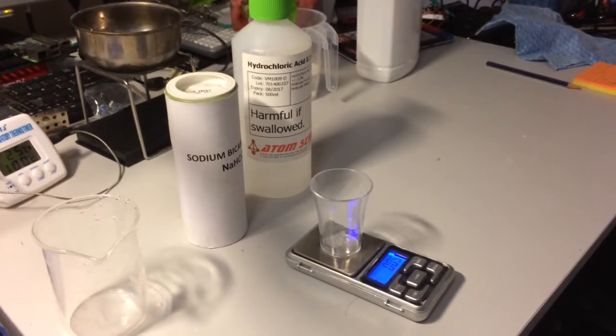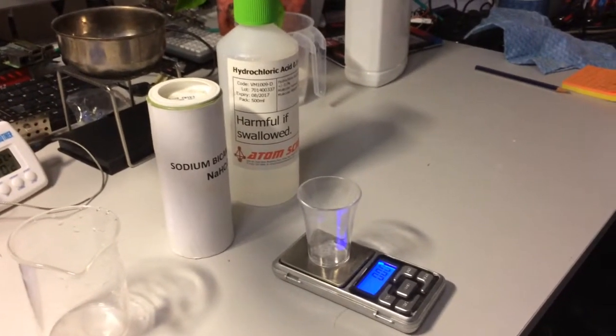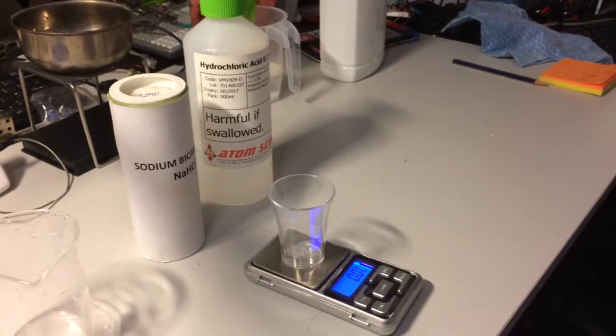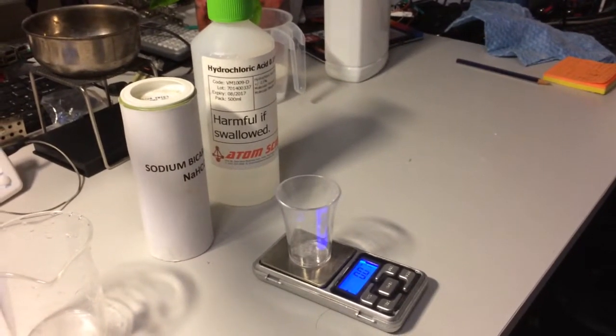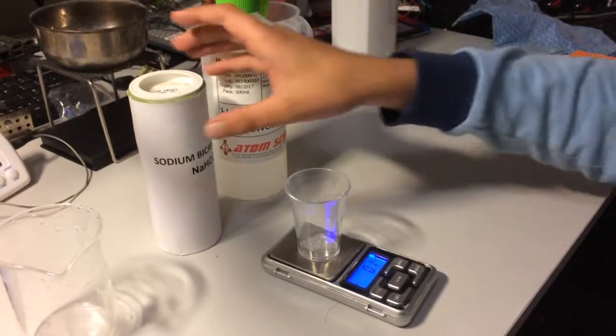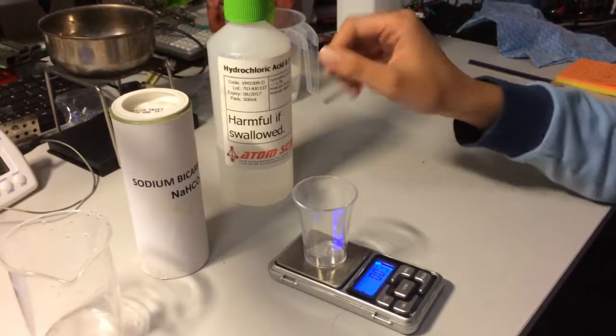Now in school, I'm studying chemical reactions. So today we will be looking at a chemical reaction with sodium bicarbonate and hydrochloric acid.